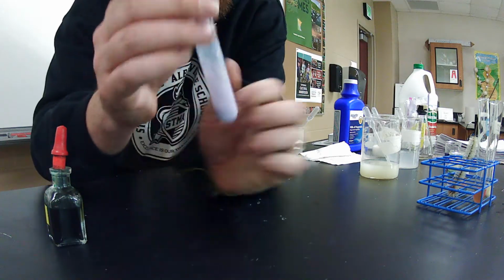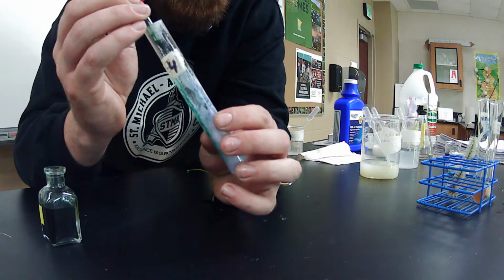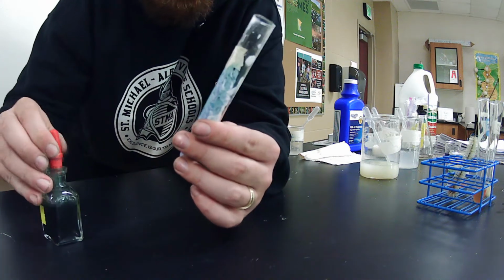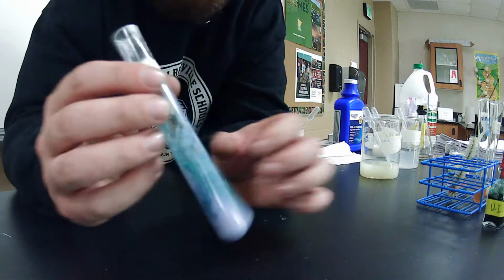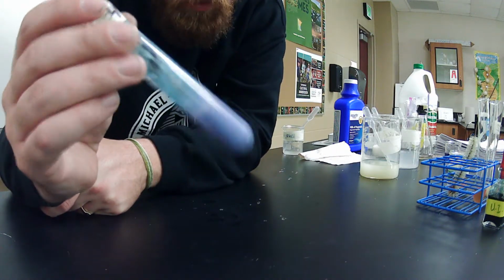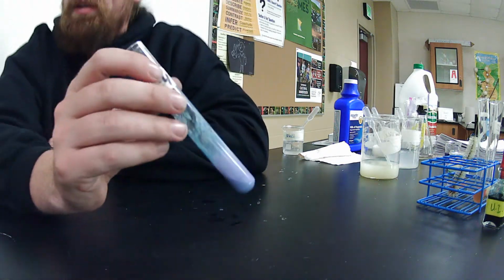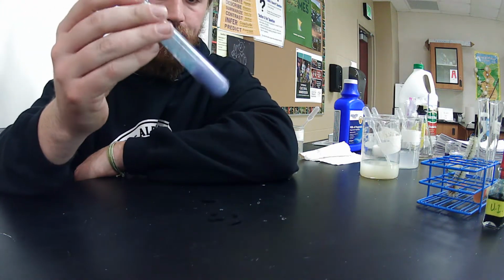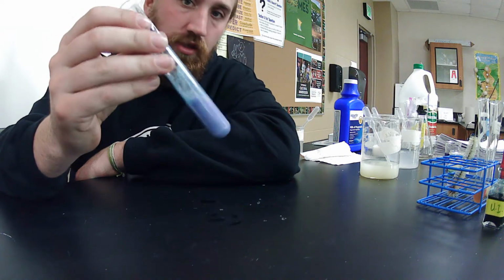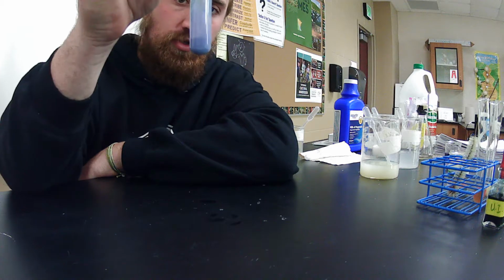Okay. Now I'm going to add a couple more drops, guys, just so you can see a little bit clearer. There we go. We're going to shake it up. And it turns pretty blue or purple, proving that it's a basic solution. Now, milk of magnesia, guys, is a buffer. Today, you're going to be learning about what a buffer is, and this is going to kind of help tie this in. So right now it's purple.